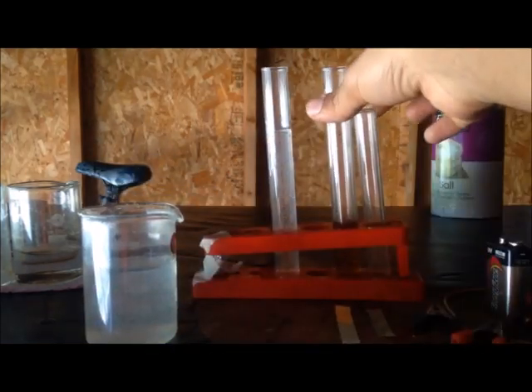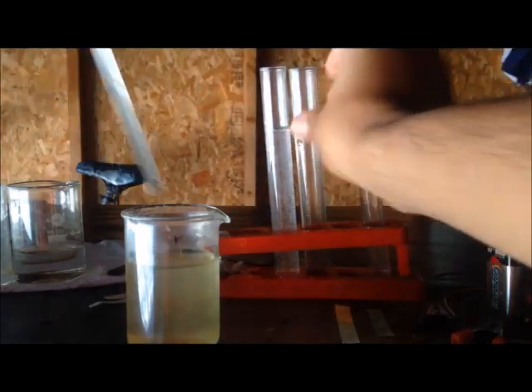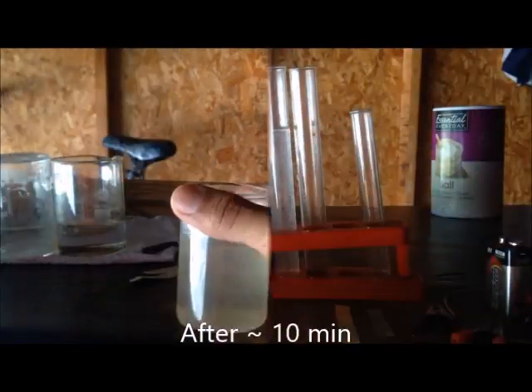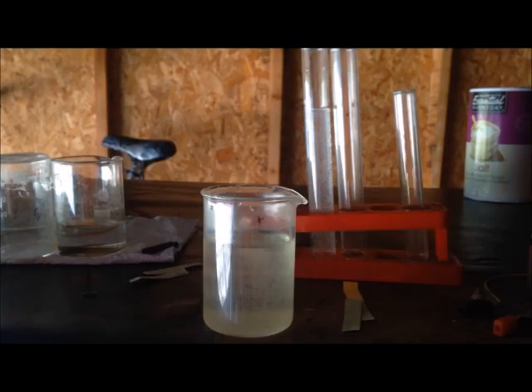I have some coffee here. You can observe that it has decolorized a little, so once again this tells us we made bleach.